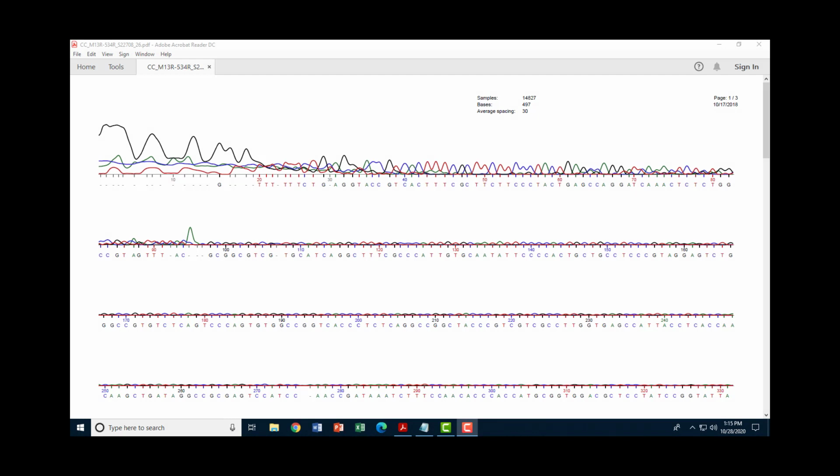This is the waveform trace file created by the machine that does the sequencing. Now when it does DNA sequencing, what it basically does is it tags different bases with a different fluorophore, and it looks for fluorescence given off by those particular sequences where they exist. And so it can read different colors emitted by the different nucleotides, and then you can use that color emission to tell you what nucleotide is at that position. So we see here the beginning of our sequence where we had a lot of the Ns from the beginning in our text file. It's all these bases right here.